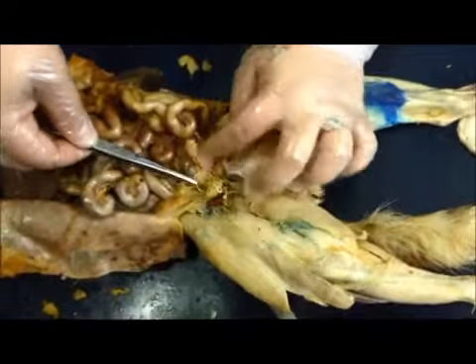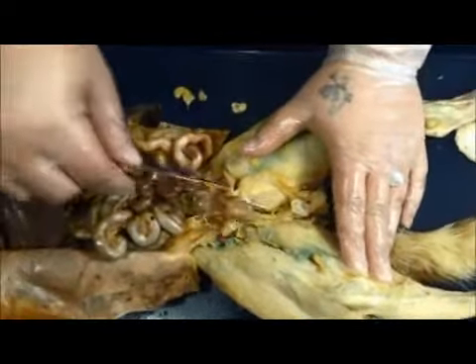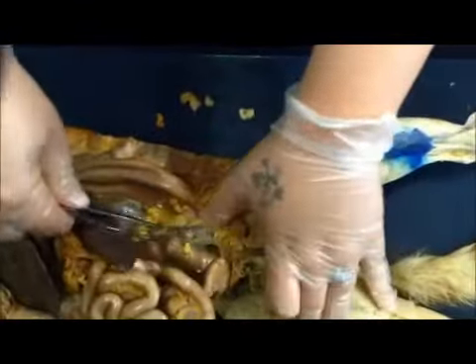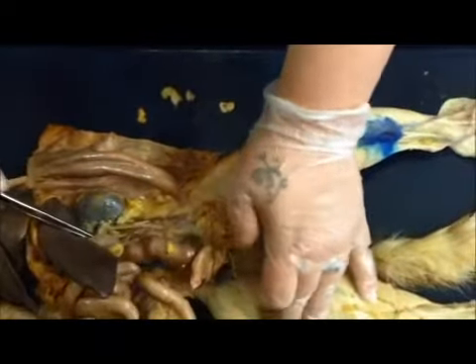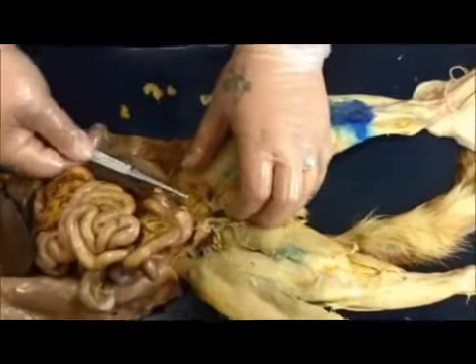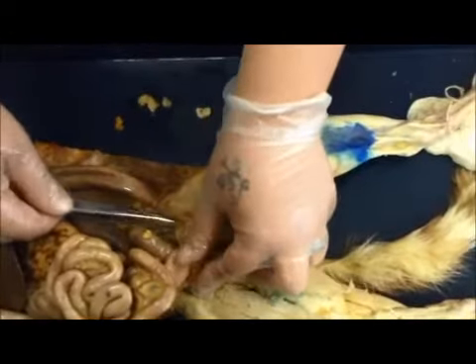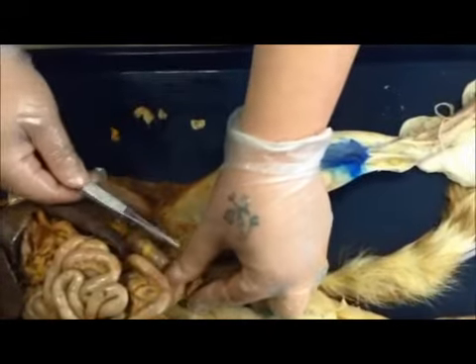Okay. And where does the ureter that connects it to the kidney, that goes up towards the top? That's right here. Okay. So it looks a lot like the vas deferens, but it goes up to the kidney. Okay. That's not the vas deferens. That's just a vein. So this is the vas deferens on this side. Oh, okay, that little teeny thing. Okay.